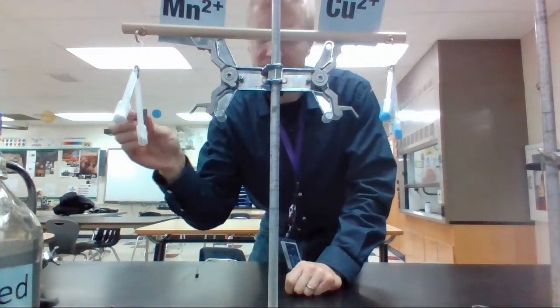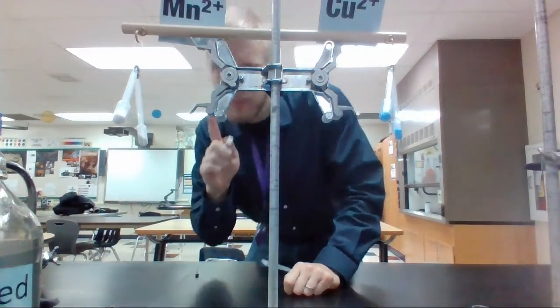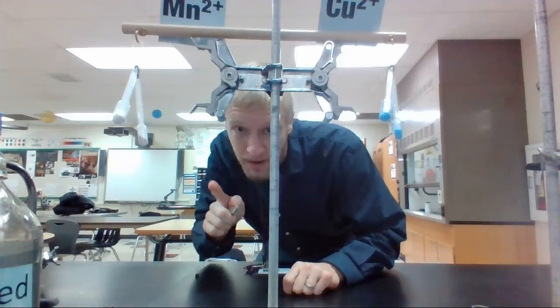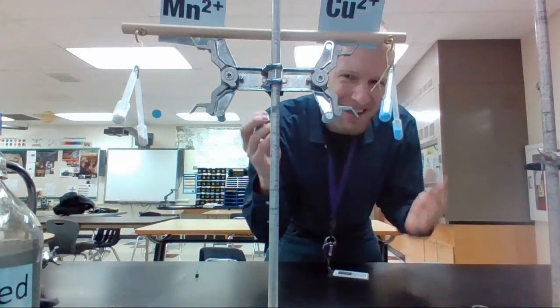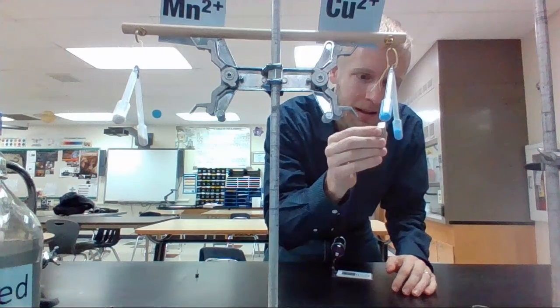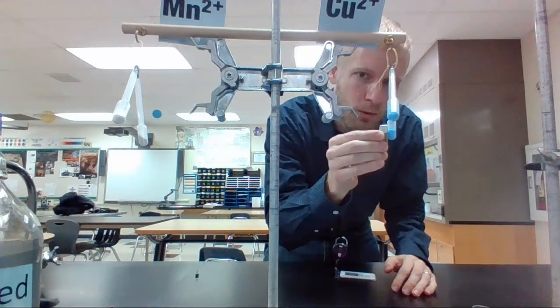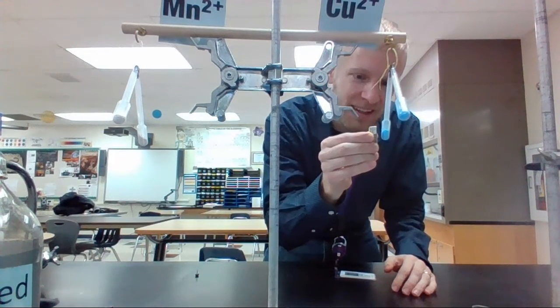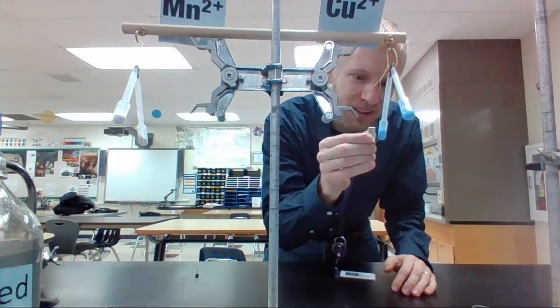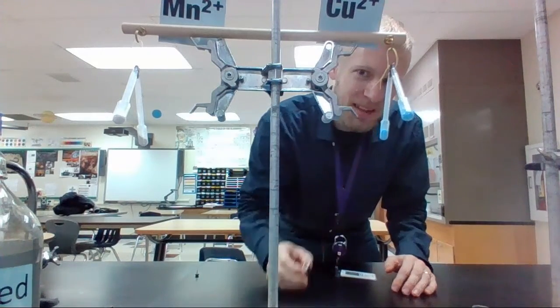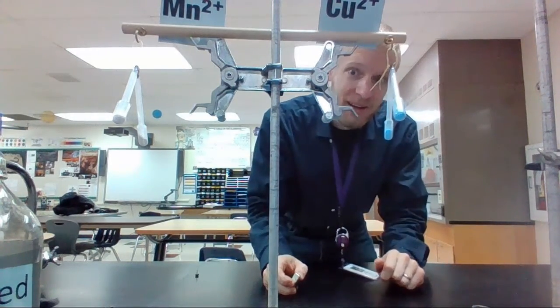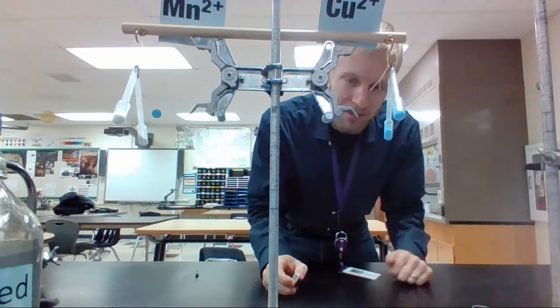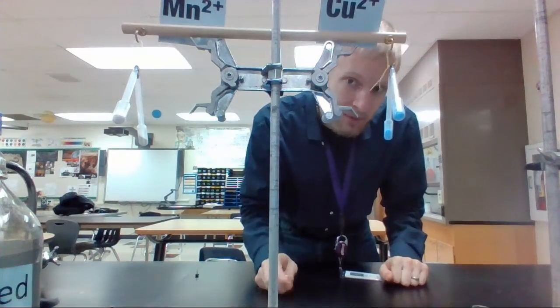Copper 2+, we said was, I believe, slightly paramagnetic. Oh, that's this one, copper 2+. It's all backwards from my end. Ooh. It's like, I've got a magical force here. So, it is slightly impacted, just so. Which confirms our hypothesis that copper 2+ is slightly paramagnetic.